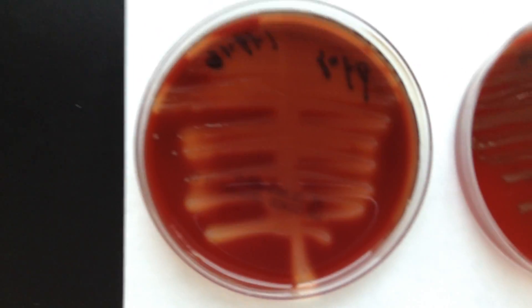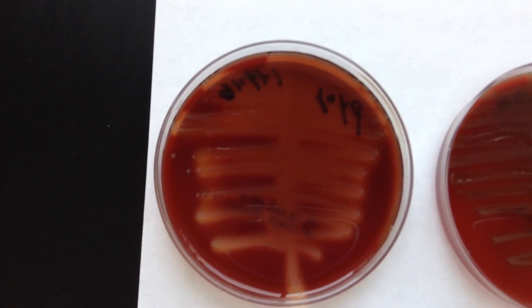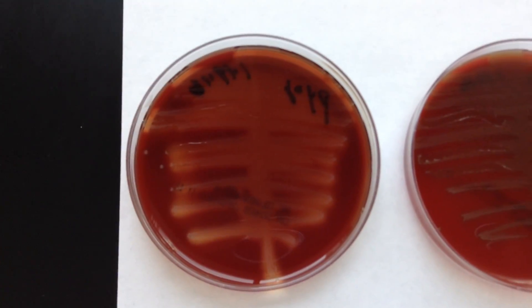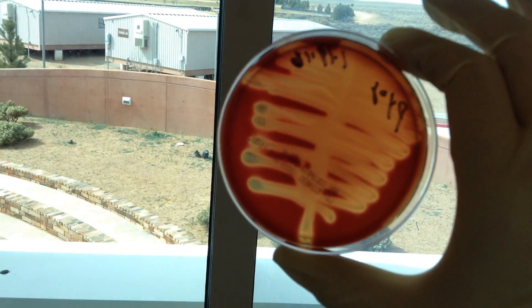The first reaction is beta hemolysis. Beta hemolysis refers to a complete breakdown of the red blood cells on the plate, and you'll actually see a clearing, which is often associated with pathogens. We're going to lift this up because it really helps to put it by the window so you can take a look at the clearing on the plate.